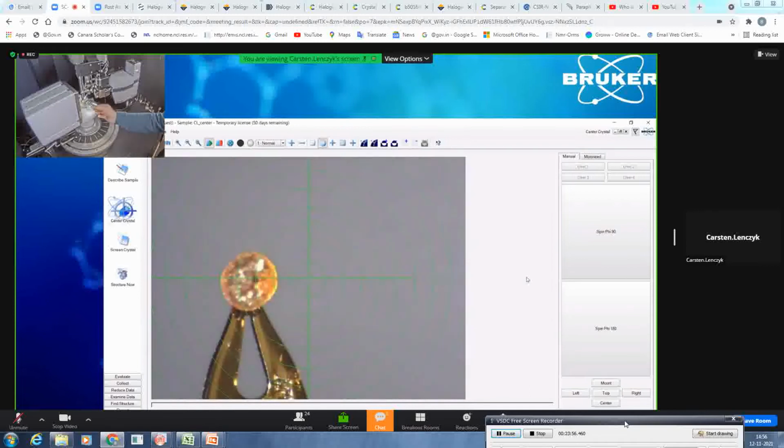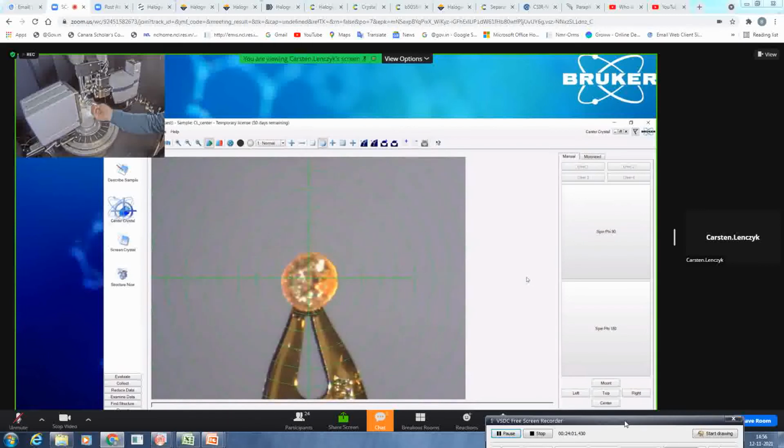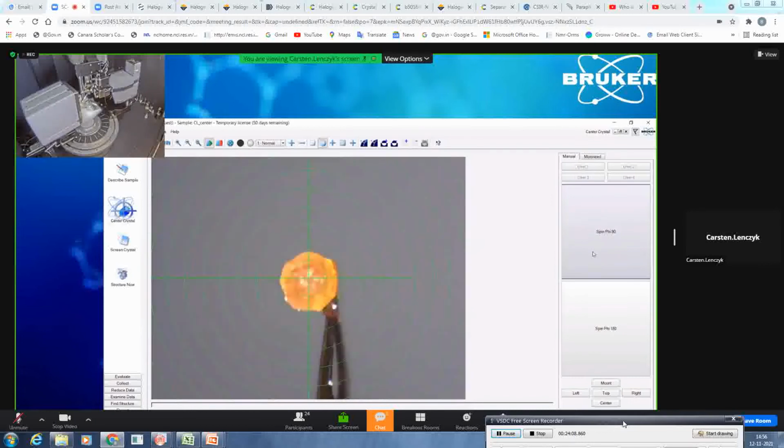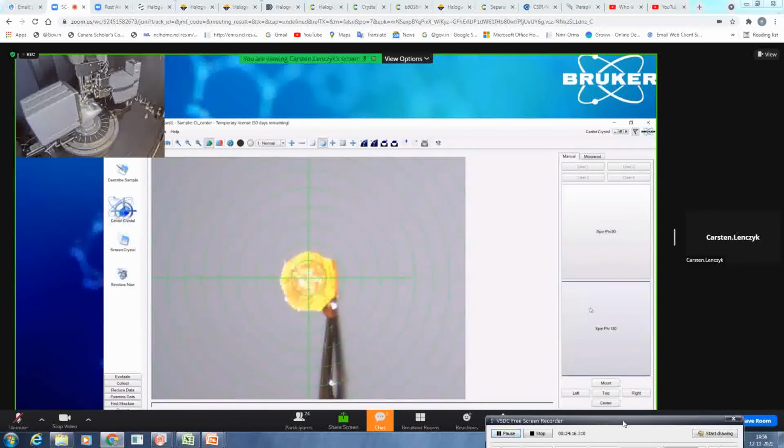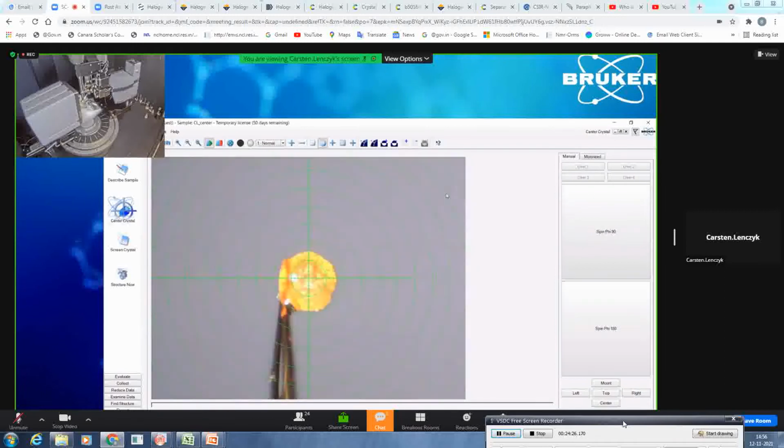Once again, we will align it left and right. And then we just click it again to ensure it stays in the center, which it does. Especially if you have very, very small crystals, I would do a second 180 degree scan and carefully check that the crystal stays in the center circle of the goniometer at all times. The same I would do also for the other alignment.